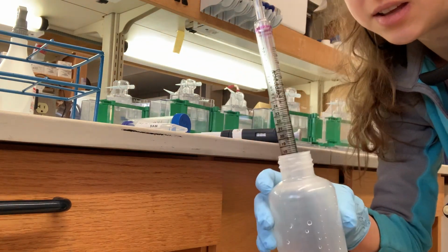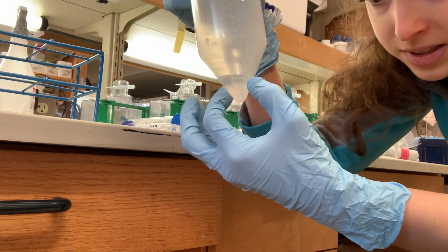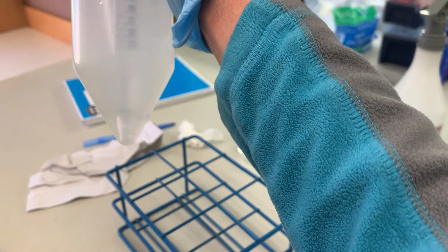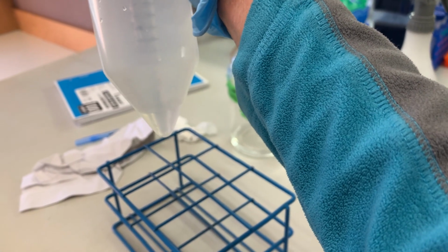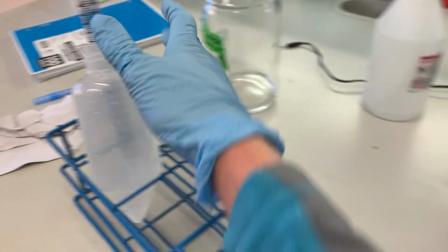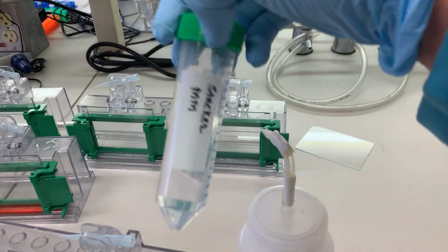I keep the pipette in the little excess fluid, and so when this liquid polymerizes, this pipette should get stuck in there, and then I can wave it around, which is fun. Okay, so now you can see that it's stuck, I mean it's hardened. It's pretty cool. But anyway, that means it's time to do the stacking.